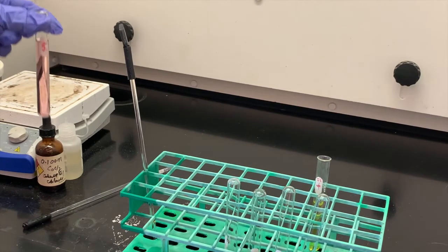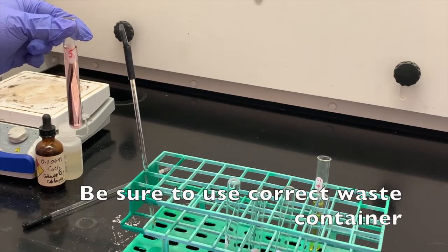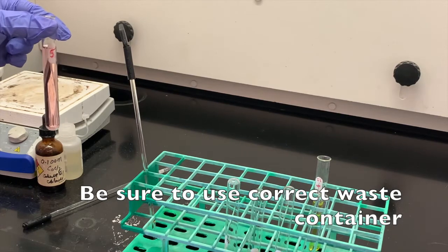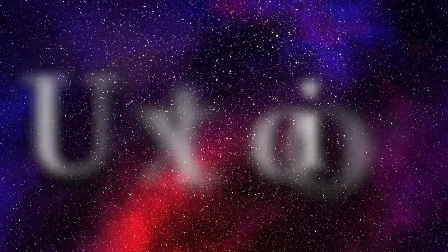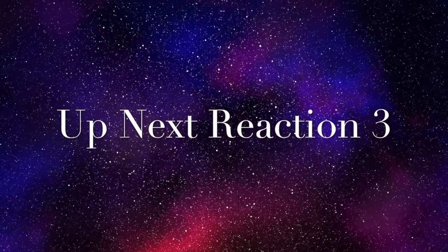Again, there's a specialized waste container for this reaction. So you'll put that in there when you're finished looking at this. So next one is we're going to give you a test tube.